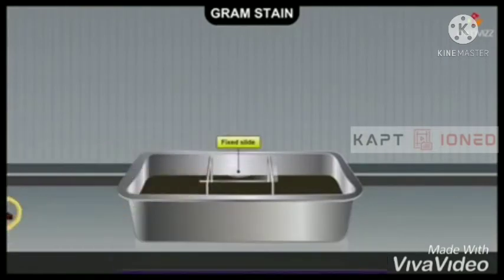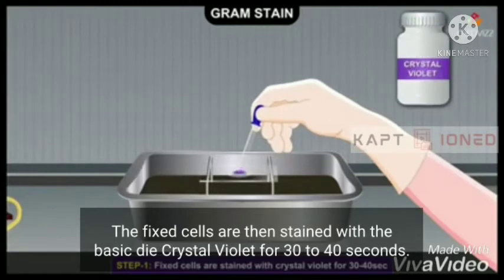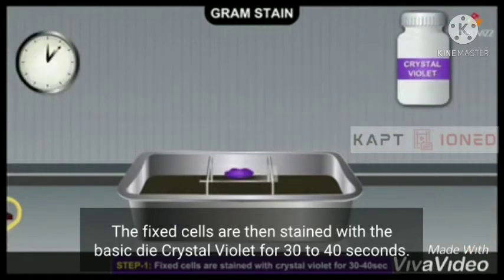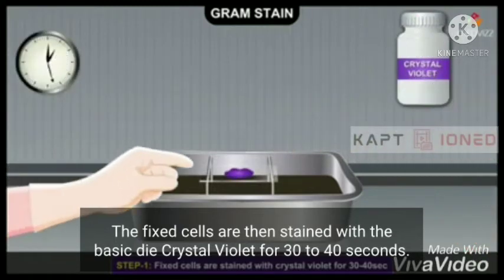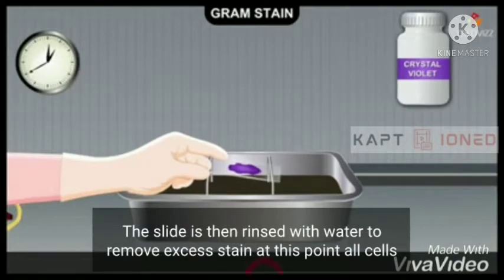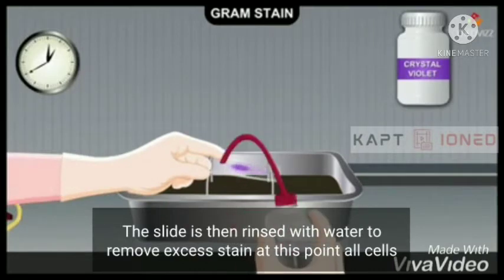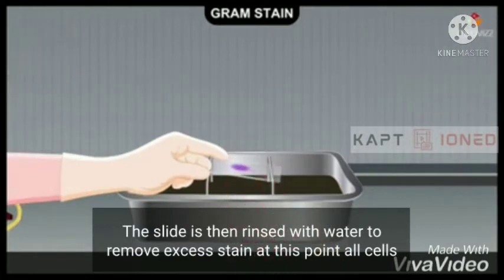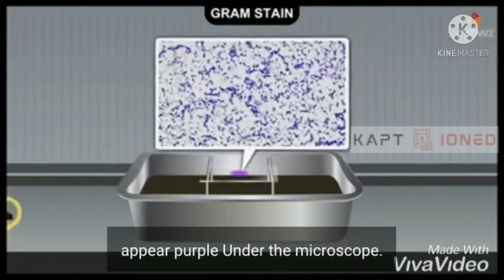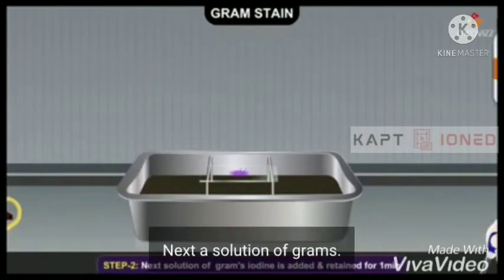The fixed cells are then stained with the basic dye crystal violet for 30 to 40 seconds. The slide is then rinsed with water to remove excess stain. At this point, all cells appear purple under the microscope.